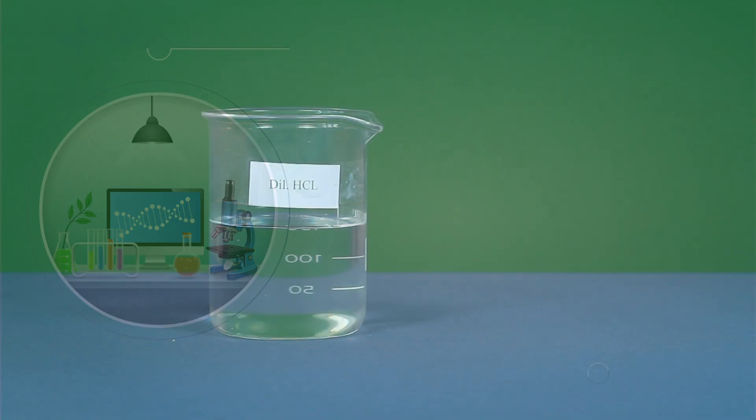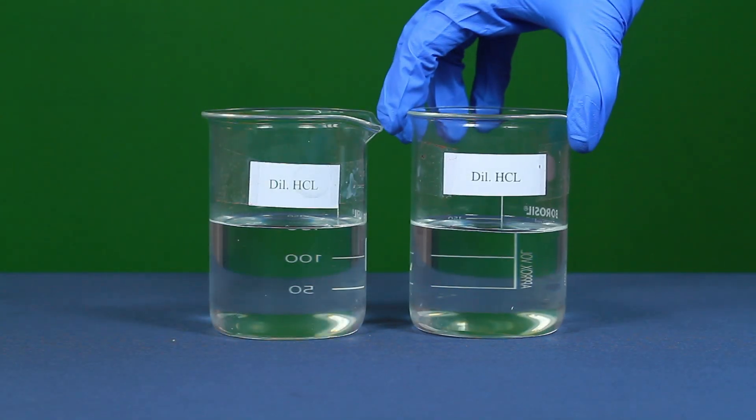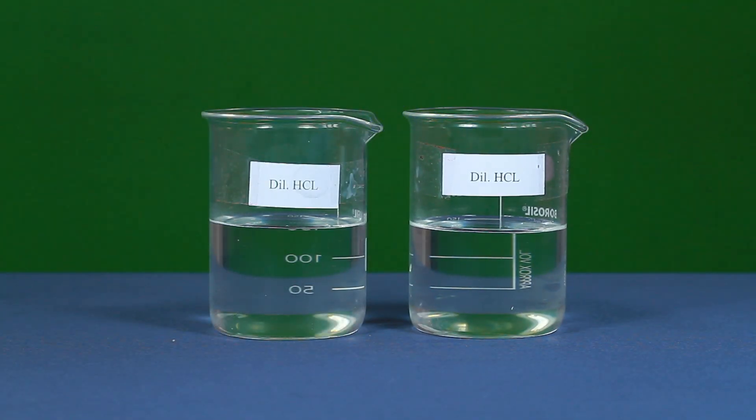Procedure: Take two separate beakers containing dilute hydrochloric acid solution.